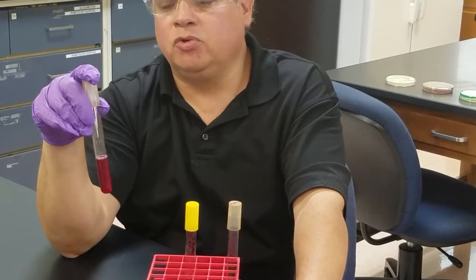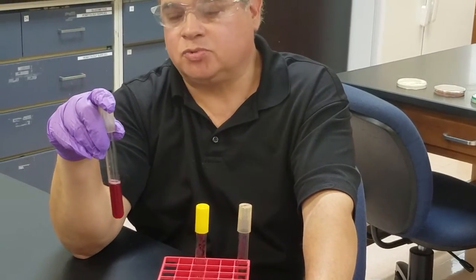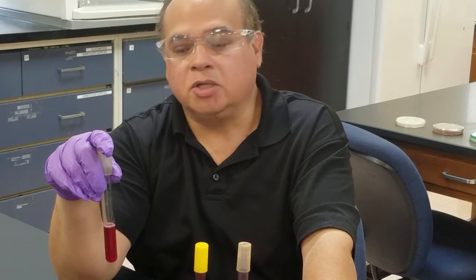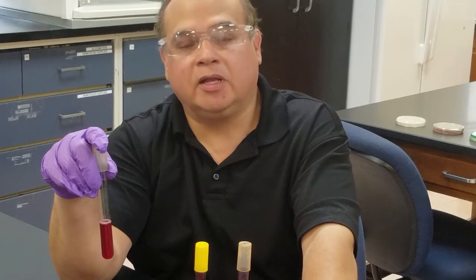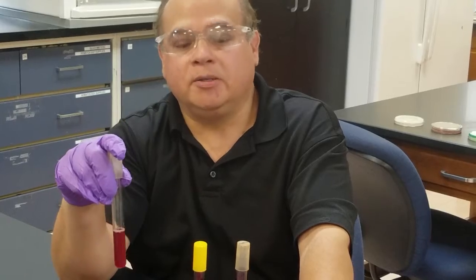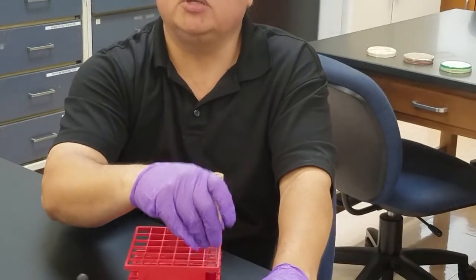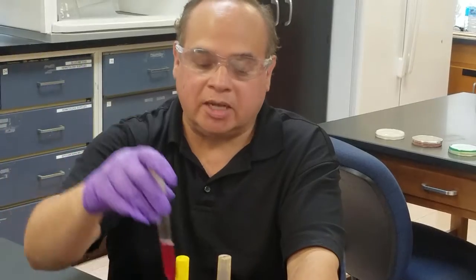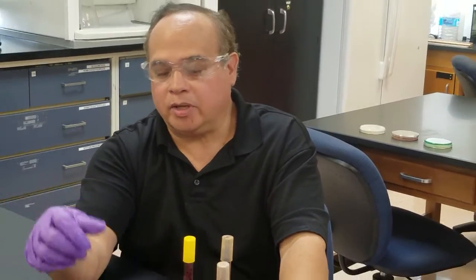If you get this result — nitrate to nitrite — after the addition of the two reagents, sulfanilic acid and naphthylamine, then you're done and don't need to do anything else. Record your results quickly because the color will oxidize and turn amber again.